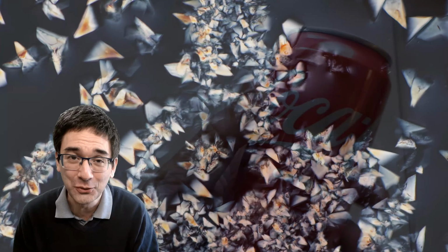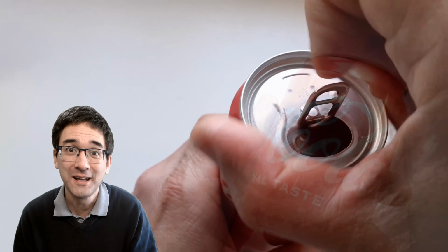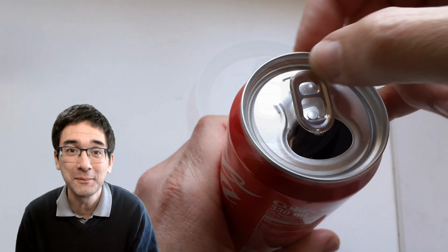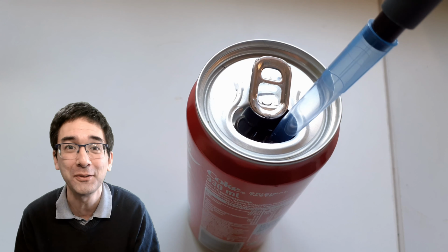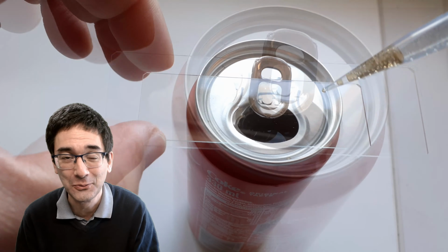But I also have to confess to you, it was not an easy thing. As a matter of fact, getting the Coke to crystallize was quite a challenge, and I'm going to talk a little bit about this, and give you some advice on what you can do if you also would like to do this.